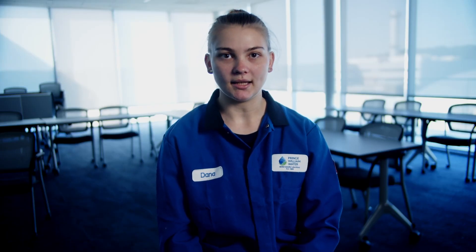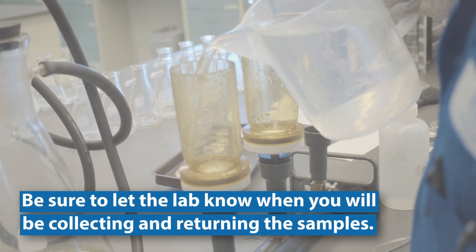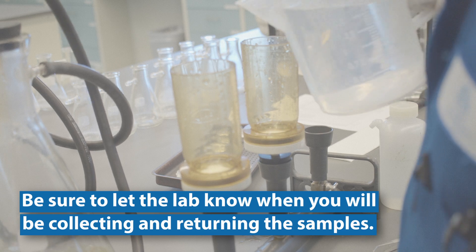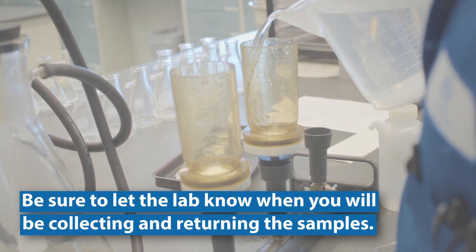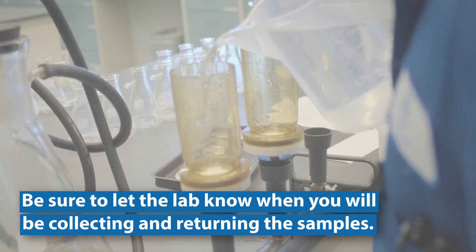The next step is to pick a date. It is a good idea to reach out to the lab to let them know when you will be collecting and returning the samples. It is also the time to ask questions if you have them.